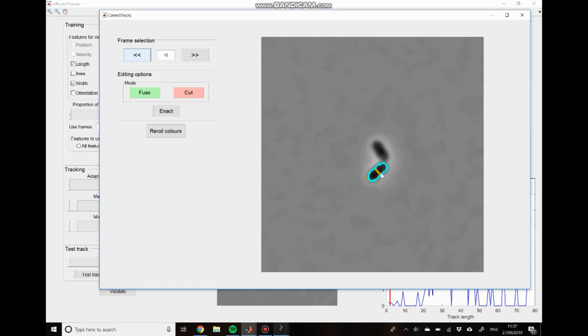What that's telling us is that in the next frame, the cell is divided into two. So this is the point where the tracks do not need to be corrected because there are two daughter cells in the next time point, but one mother cell in the previous time point. So it's accurate that those trajectories should be broken. So we can skip over that particular cell. And I'm just going to go through and continue manually correcting these fusion events.